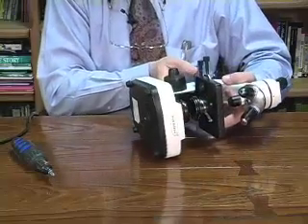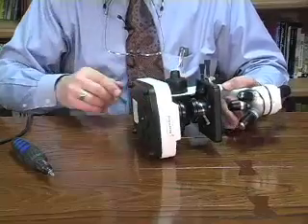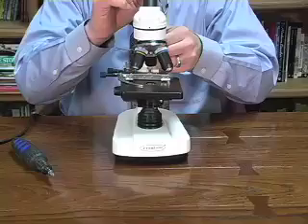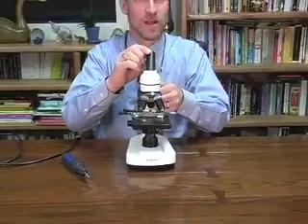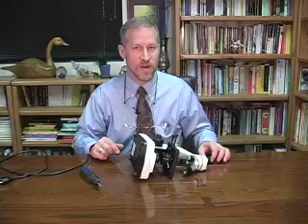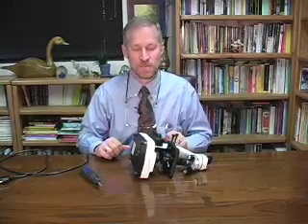So, I should point out something else I just realized as I turned this to the side. I had not attached my ocular lens, so when I turned it on its side, I flipped it out and tossed it on the floor. Don't you do the same. If it's not attached, if you haven't screwed it in, which most of us will not, please remove that first before you begin working on the bottom of the microscope.